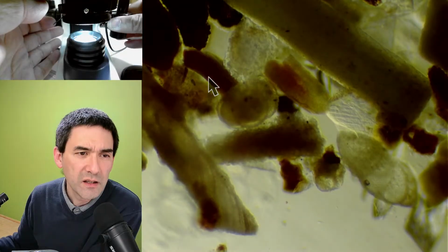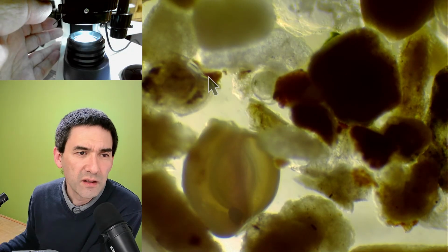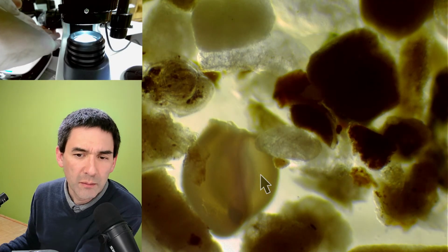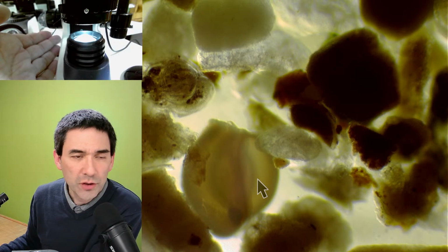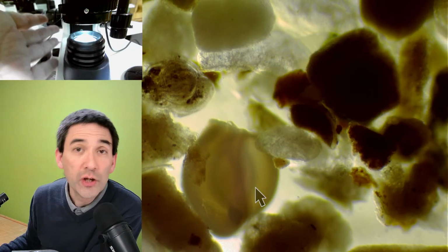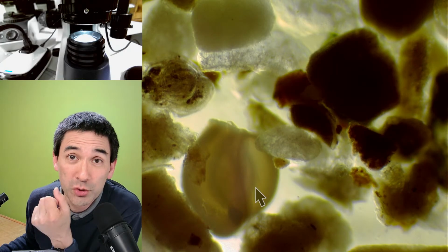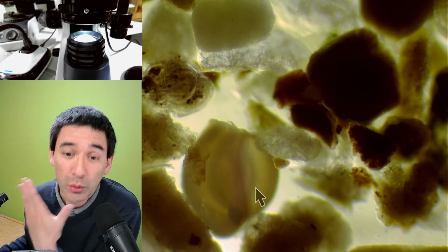The effect is not quite strong here. That's a foram here as well. Yeah. These are basically also the shells of marine microbes. Top light oblique is a question. No, I don't have top light, and generally it won't always work as well, because especially at higher magnifications I have problems shining a light from the top, because the objective of the microscope actually is blocking the light.